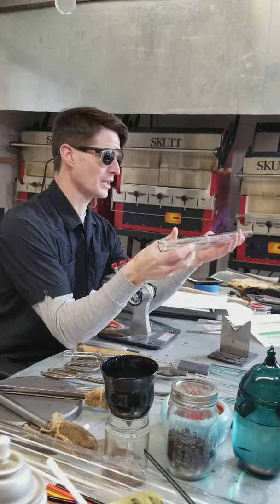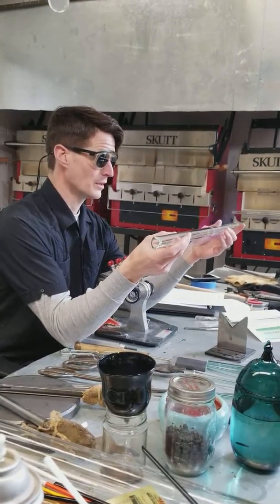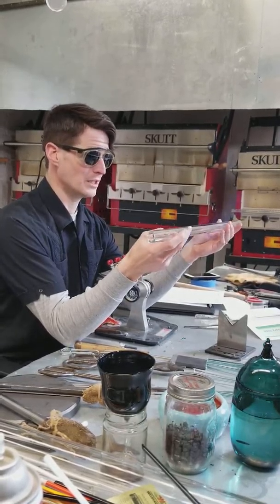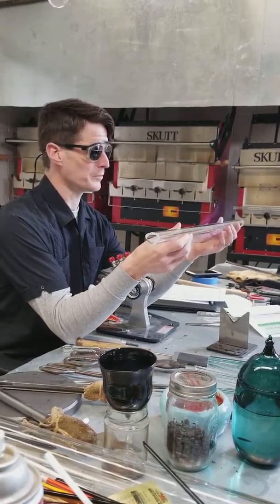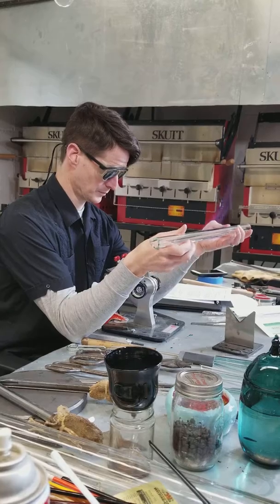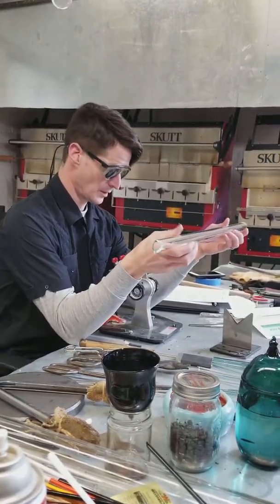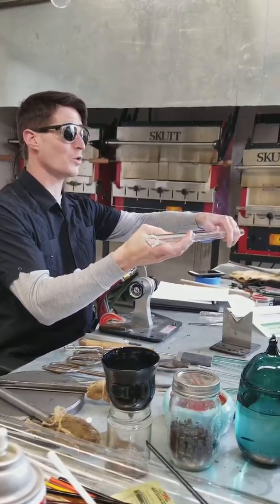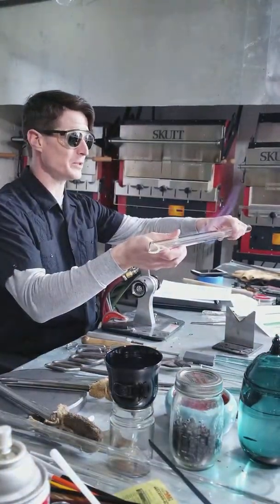I'm just warming this in and you can see the condensation of the water that is present. See how on the edges of where the heat is licking, the flame is splashing wide — that's called the jet wash. We want to just warm that in so that you don't get condensation build up, in particular on the end.